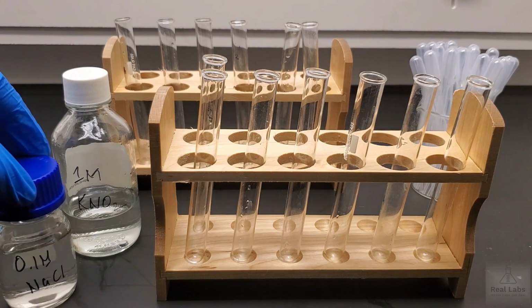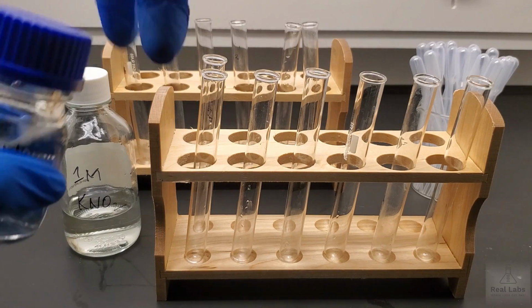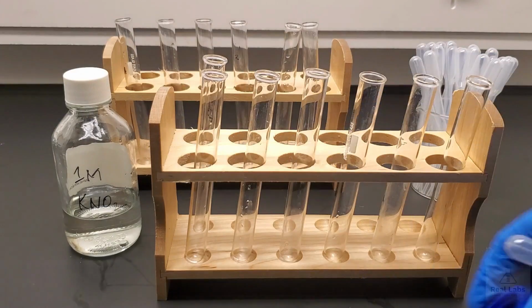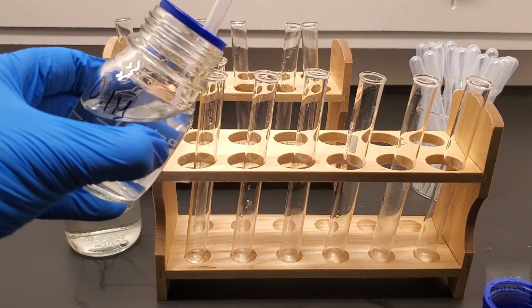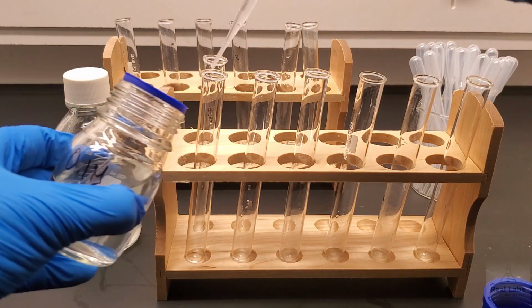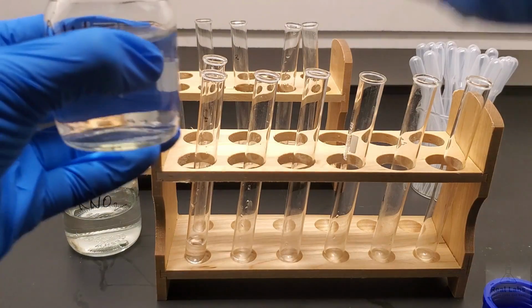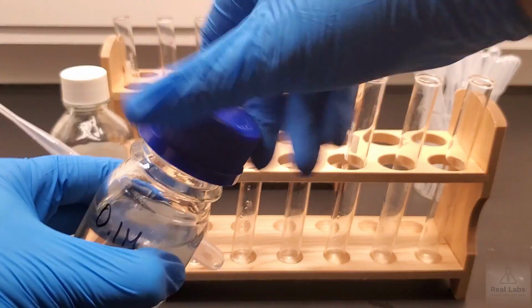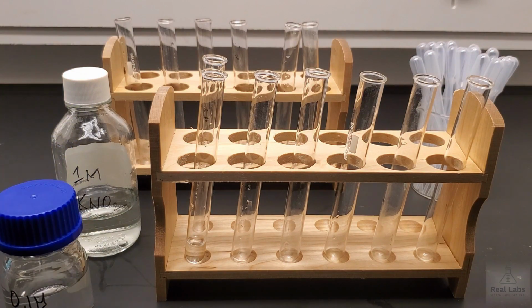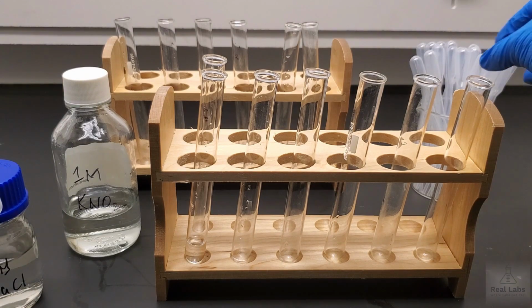So we're going to start by adding about 1.5 ml of each of these systems into a test tube. So we're going to pick one test tube. We're just going to start on the left here in the front rack. And I'm going to add about 1.5 ml, so about a pipette full of that material to the first test tube. And I'm going to use disposable pipettes for all of this because we're going to be going through quite a lot of samples. I'm going to keep them associated with the sample. We don't want any cross-contamination, so we're not going to reuse the same pipette for a different material.